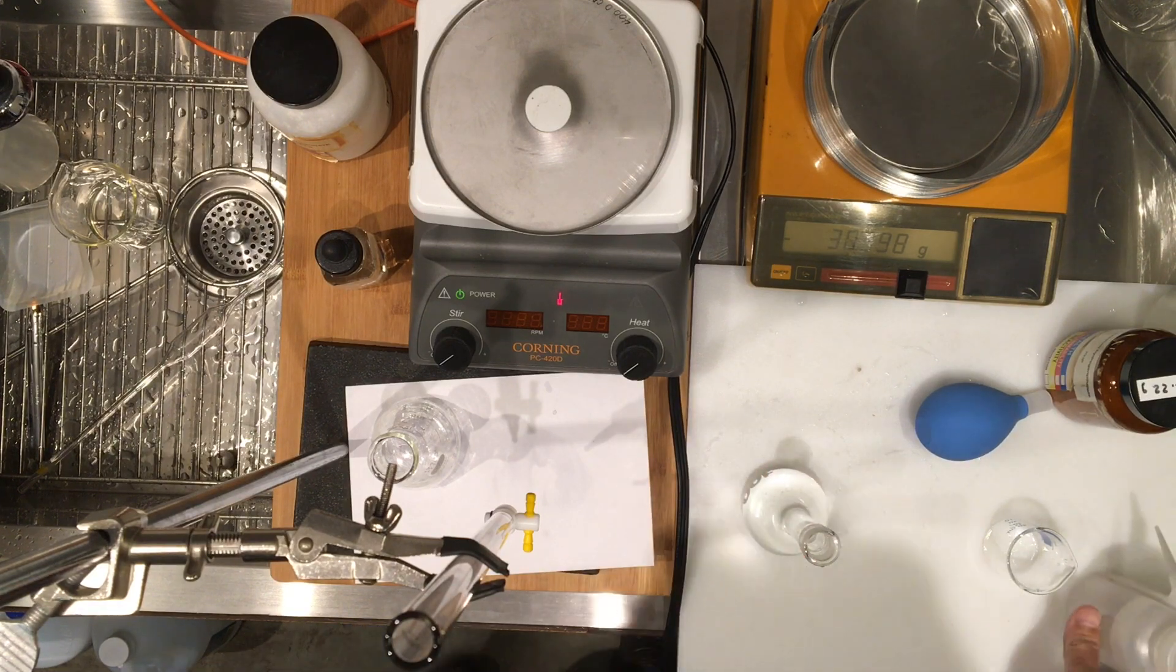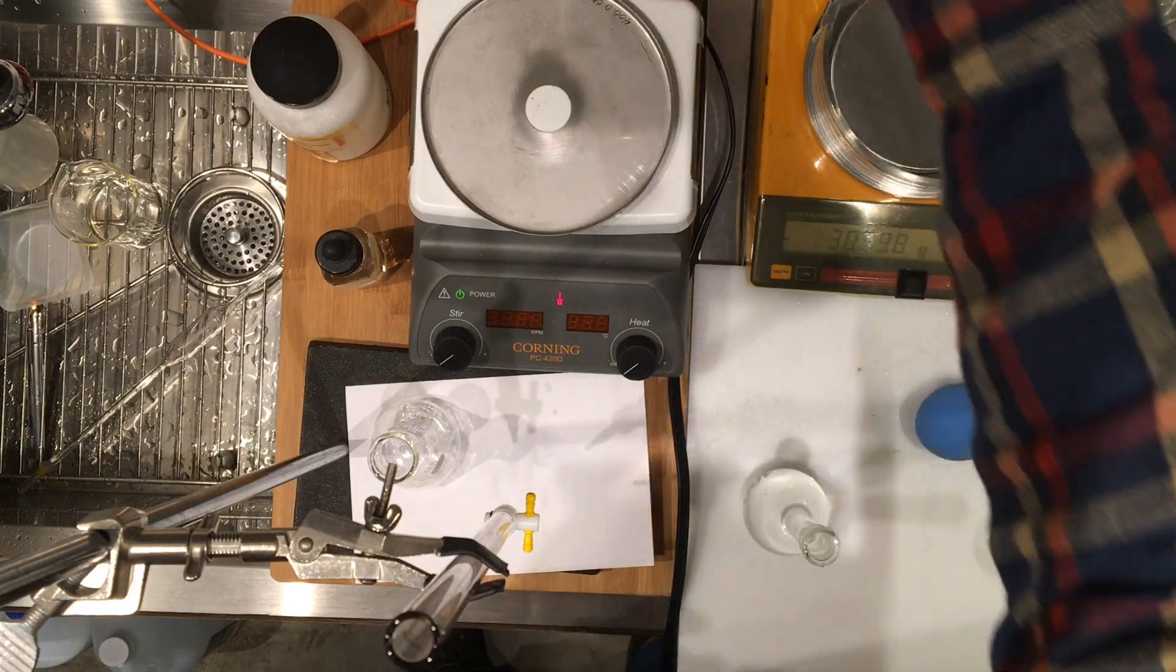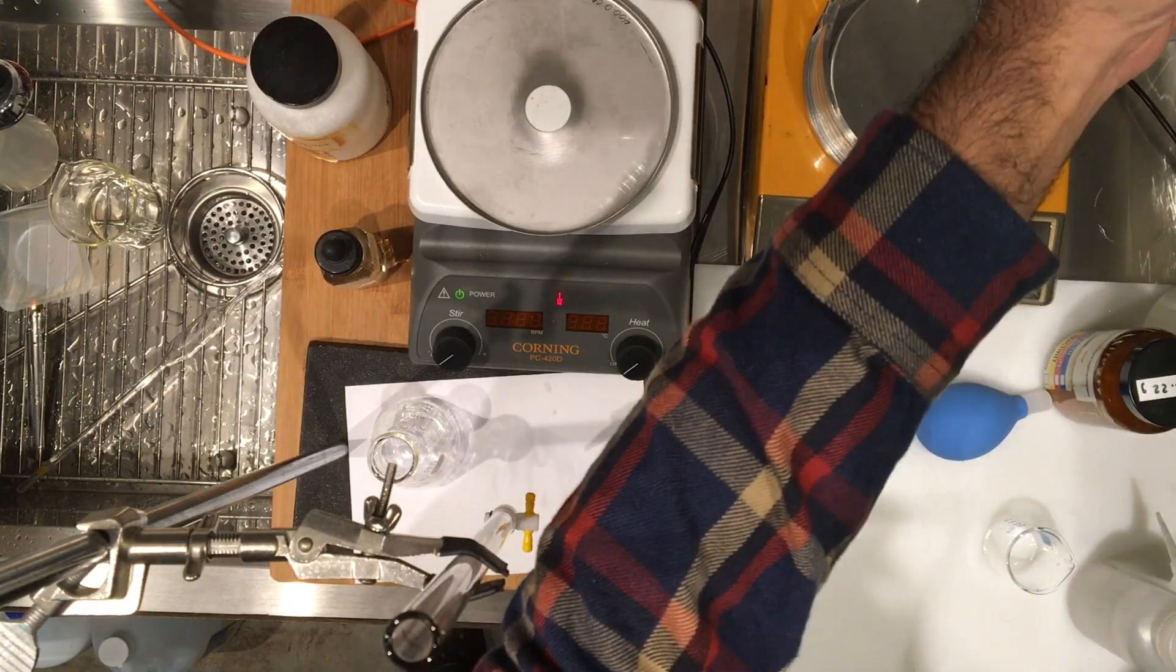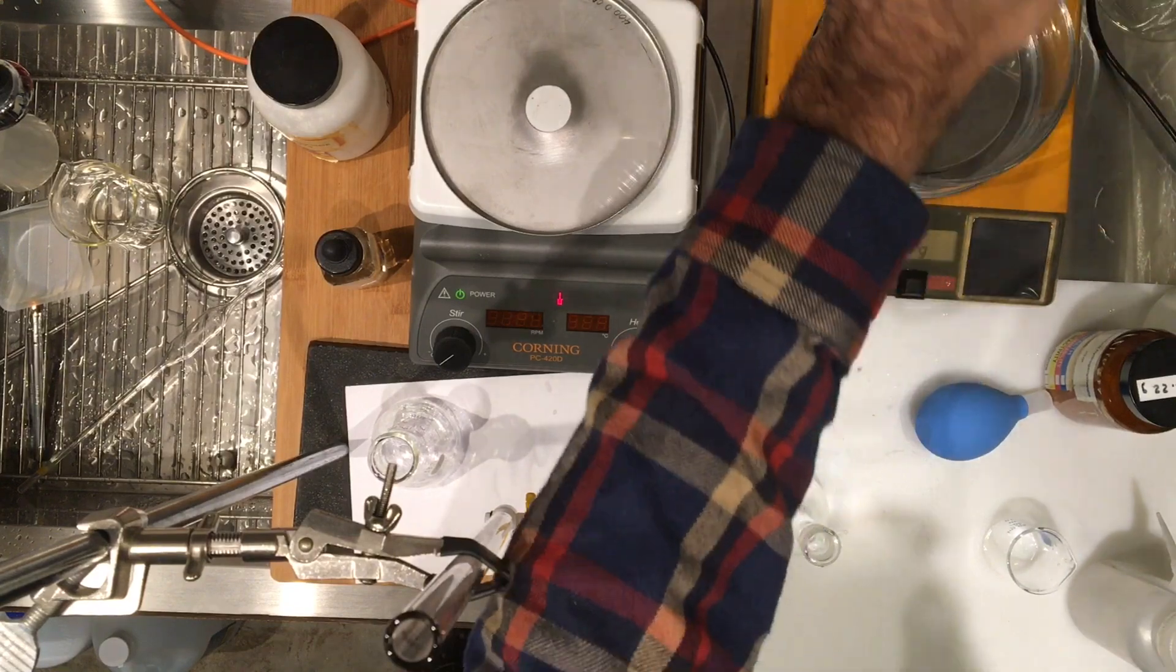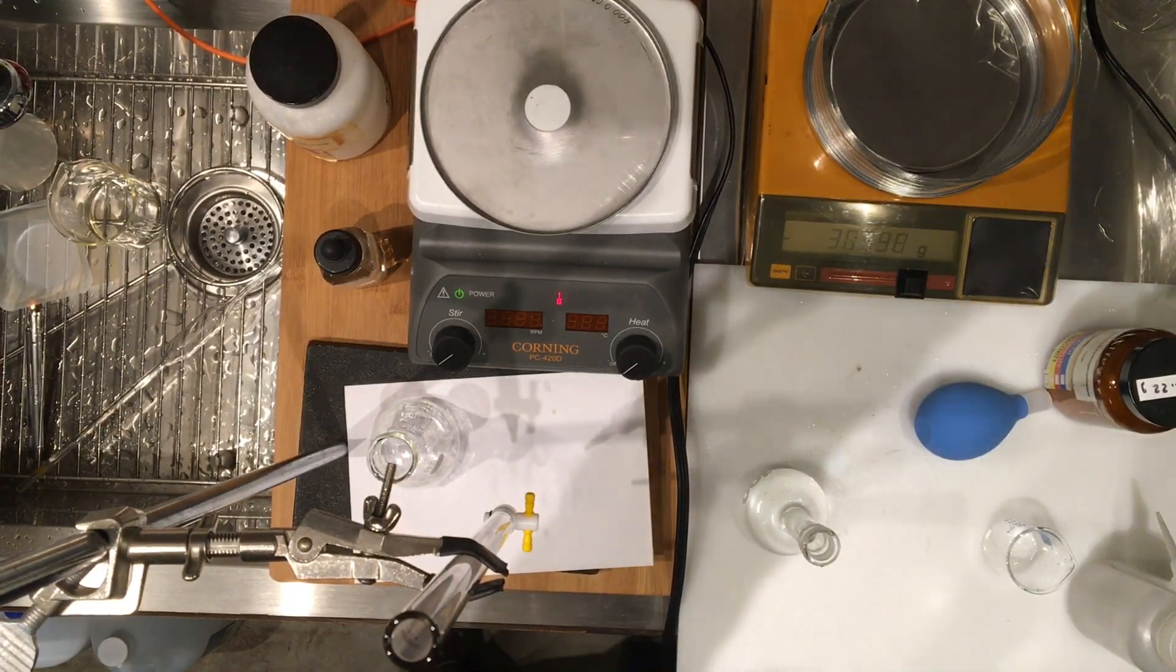Okay, now I got that. So now I'm going to use a piece of parafilm and cover up the flask.